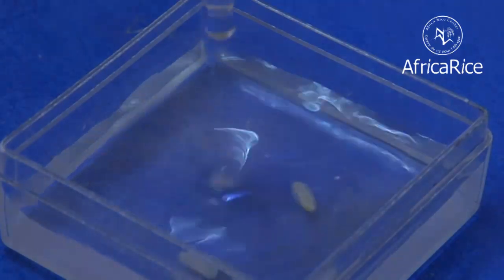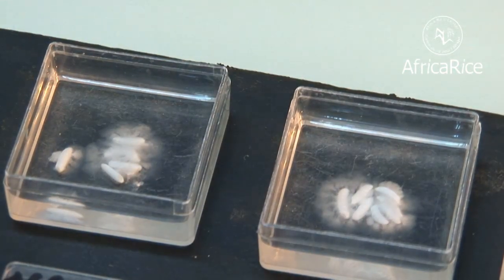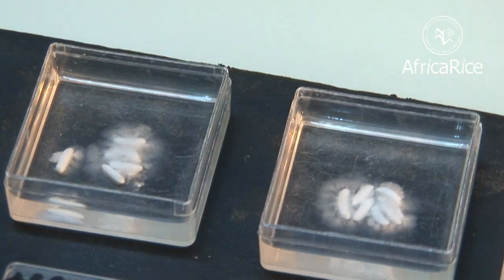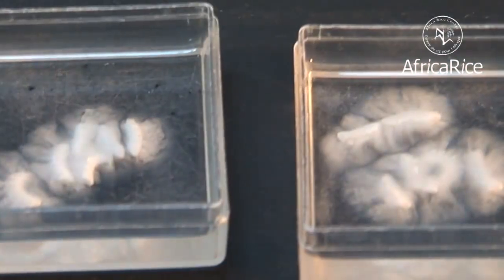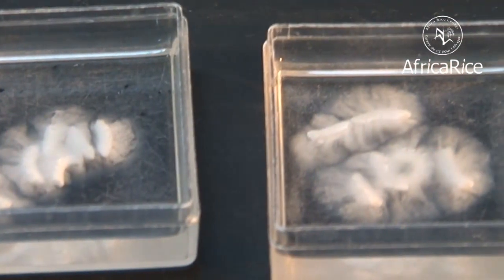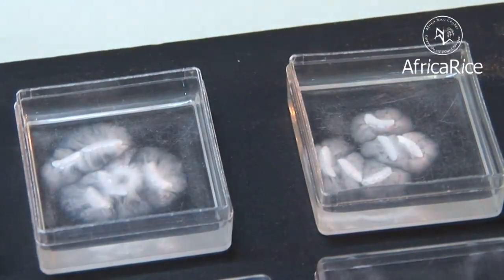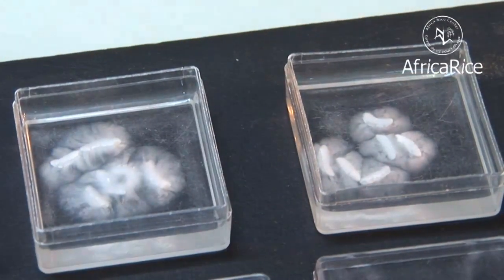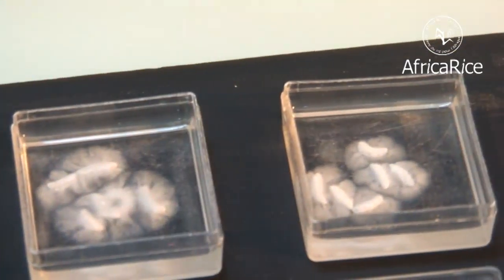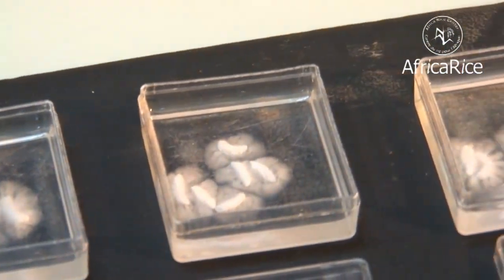The following day, it can be seen that the alkali has dissolved the grains to different degrees according to the hardness of the grains. The extent to which the alkali dissolves the grains gives an indication of the gelatinization temperature, and rice can be classified into low, intermediate, and high gelatinization temperature groups.